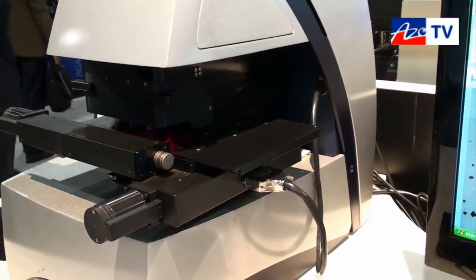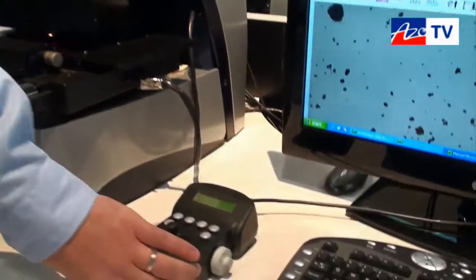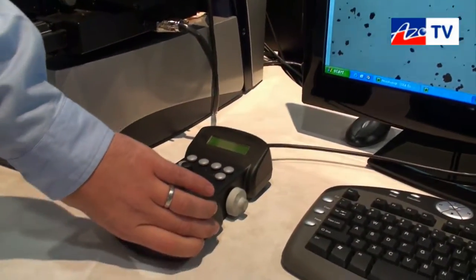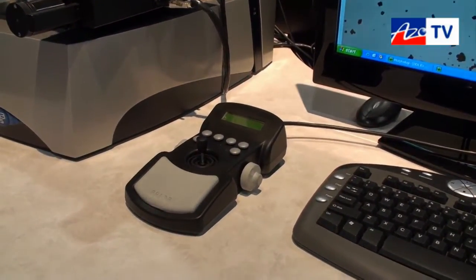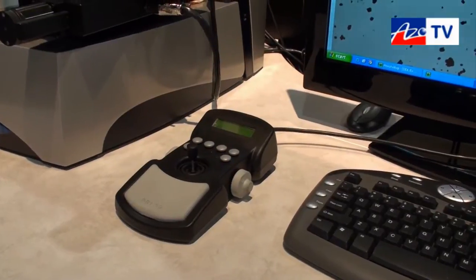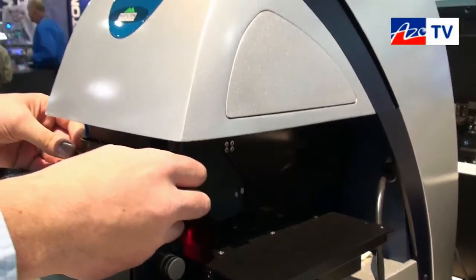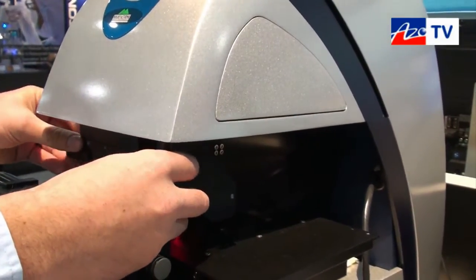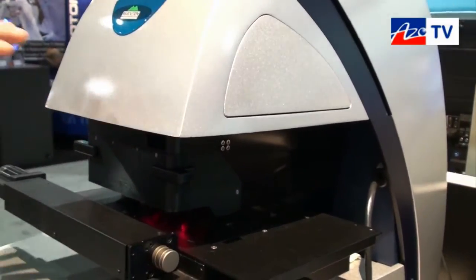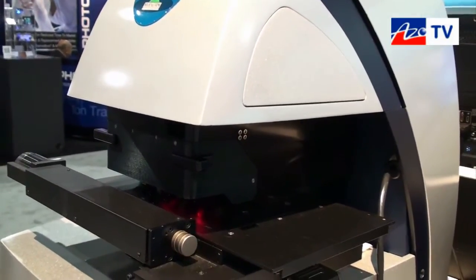A couple of the features of the new hardware: we have an upgraded joystick that allows a lot more fine control over the positioning of the stage. We also have safety features that have been added so that any of the Raman laser light will be locked out if the system is open to the air, making it very safe for a user.